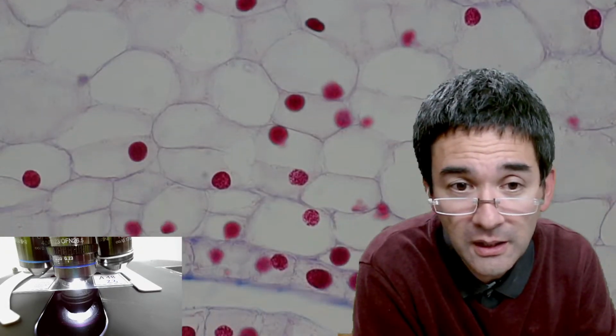And some minutes ago I showed you the cells of onions, and here these are the cells of a lily, and occasionally we are able to see chromosomes here. And the chromosomes here in the lily are much nicer, but there are not as many of them. So I lost everything here right now, okay?